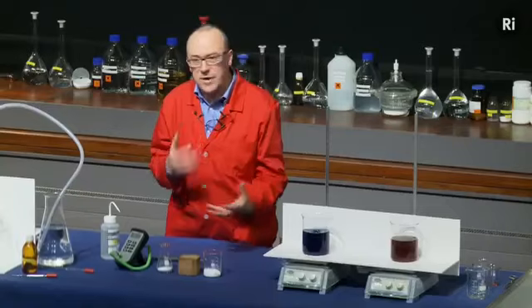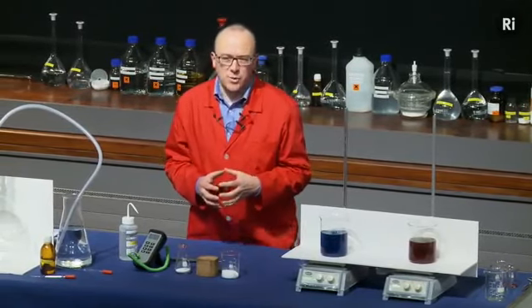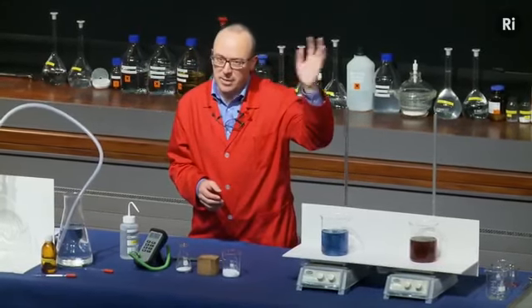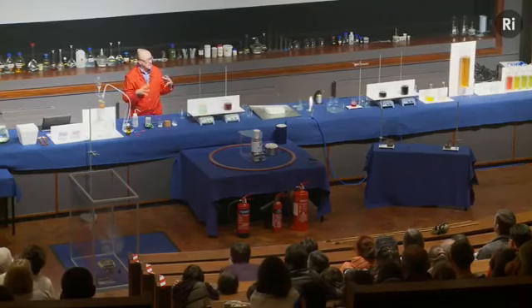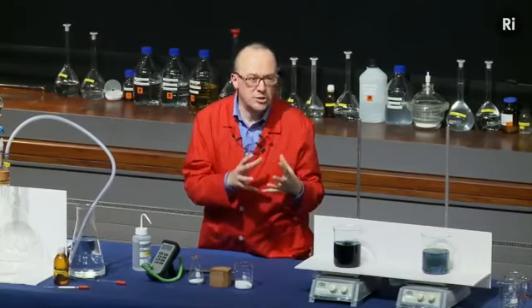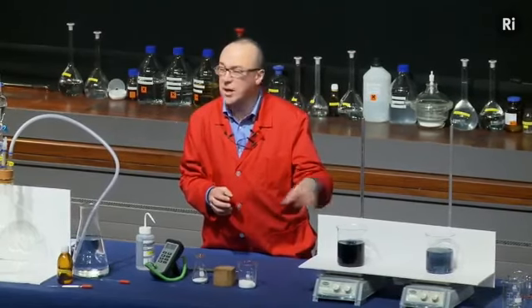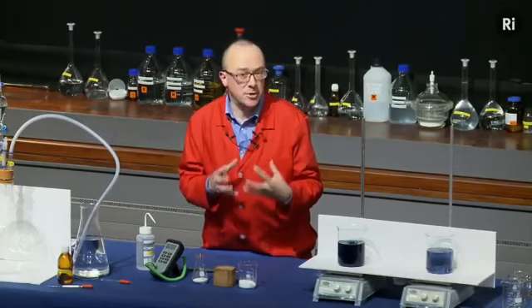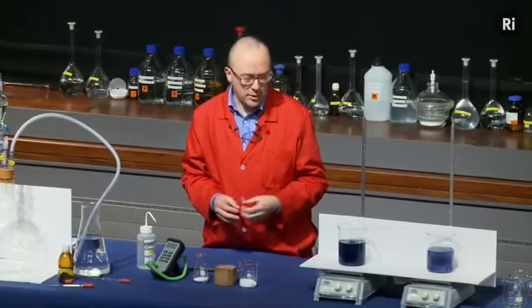So it seems as if we've found a chemical reaction that does actually go backwards. But really that isn't what's happening. It's not like a ball rolling downhill and then changing its mind and rolling back uphill again. It's more like a ball going down a sort of helix. It gets back to the same colour as when it started, but it's not really in the same condition because some of the chemicals have been used up. And we can watch these oscillations happening, but after 10 or 20 minutes, they will come to a stop. And that's because the chemicals have been used up. So we haven't really found a reaction yet that can go backwards.